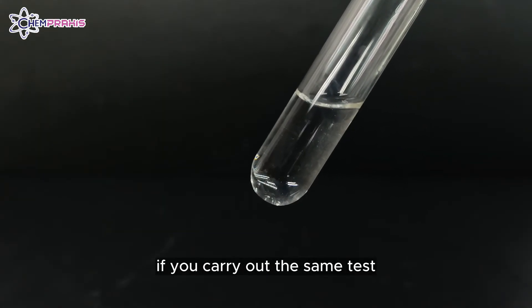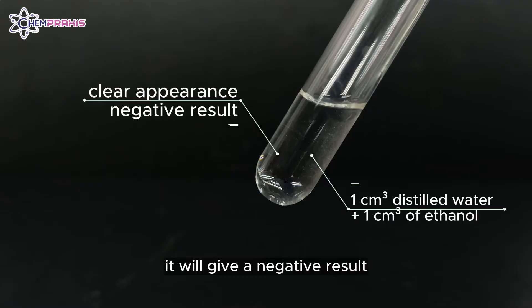In contrast, if we carry out the same test on a sample that does not contain lipids, it will give a negative result.